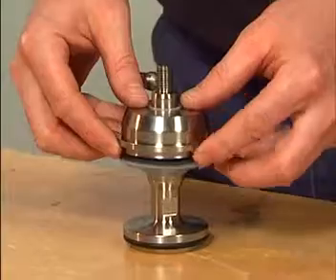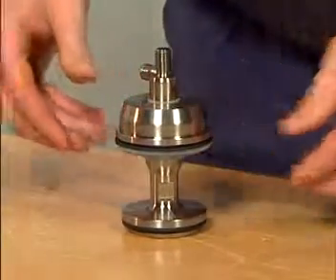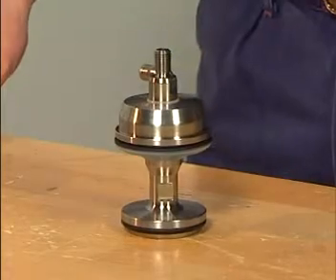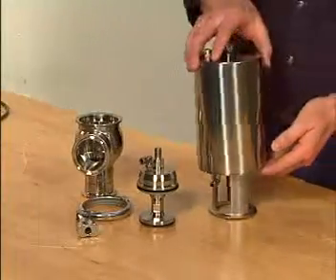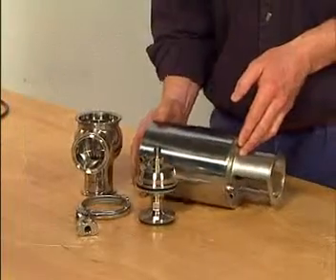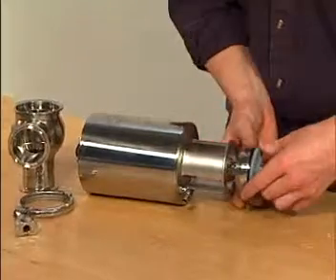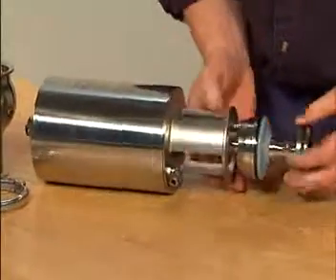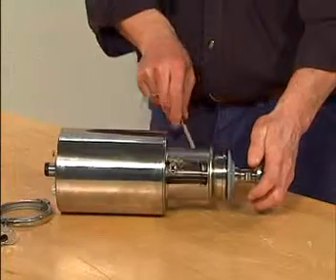Place the bonnet on the aseptic valve plug and connect the bonnet to the diaphragm. Be careful to ensure that the diaphragm mounts properly. Connect the plug assembly with the actuator and tighten. Use two size 17 spanners to tighten firmly.